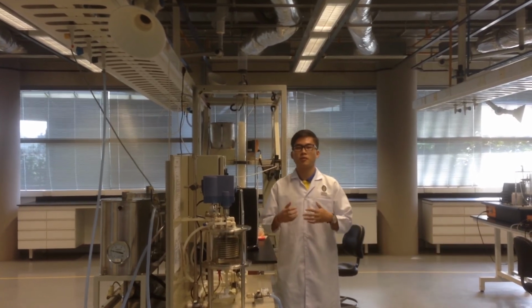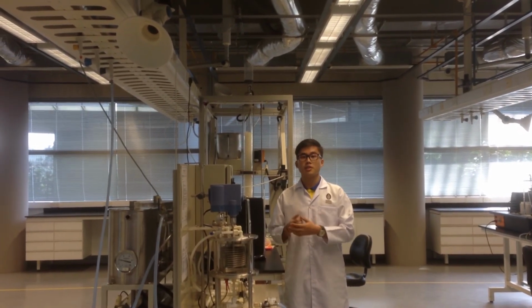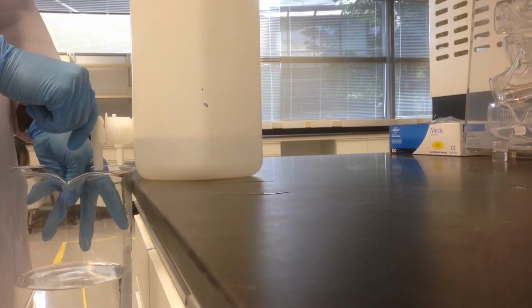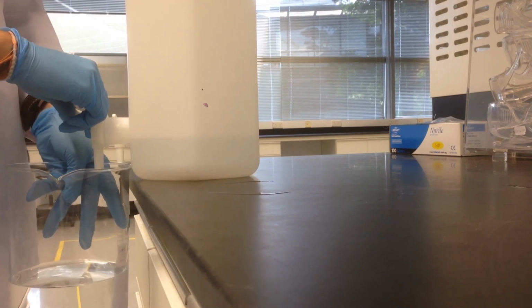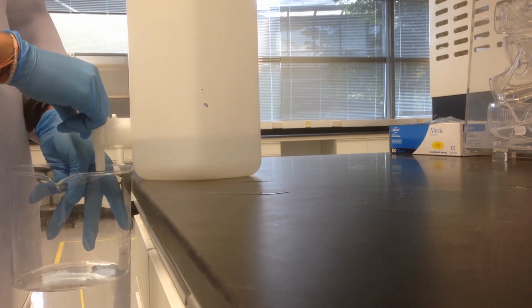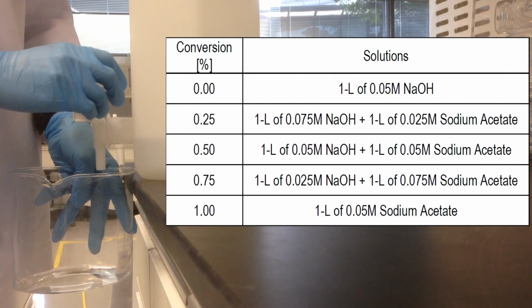For this experiment, there are two parts we need to do. First is the preparation of the calibration curve for conversion and conductivity. The second part is to study the batch saponification reaction of ethyl acetate and sodium hydroxide. For conversion of 0.00, prepare 1 liter of 0.05 mole of sodium hydroxide. As for the second, third, fourth and fifth, we have to do the conversions of 0.25, 0.5, 0.75 and 1, and the table is right here.